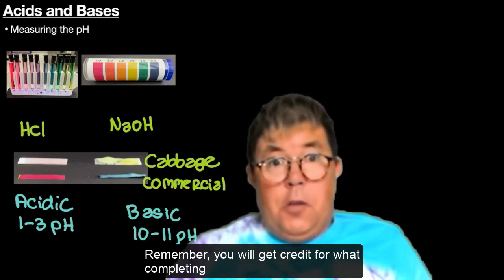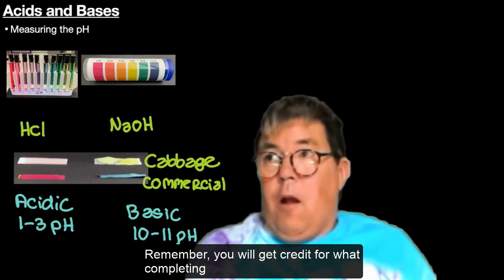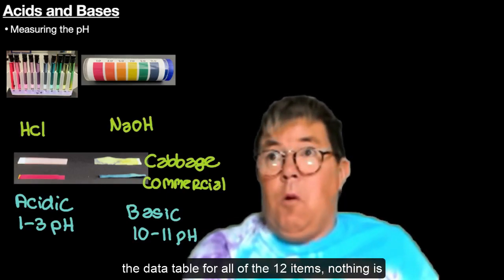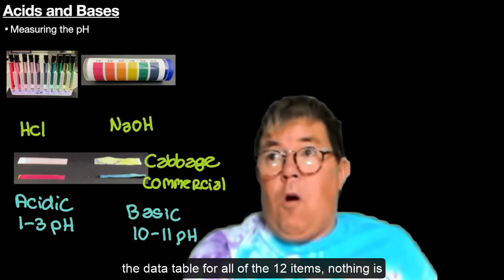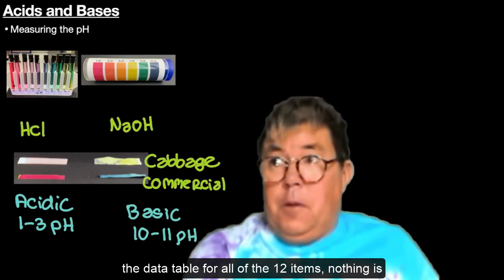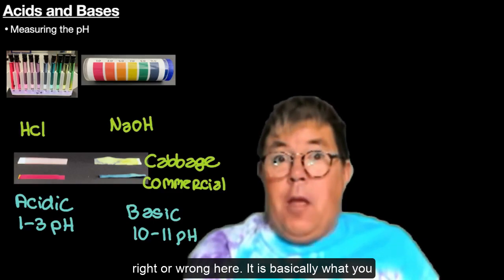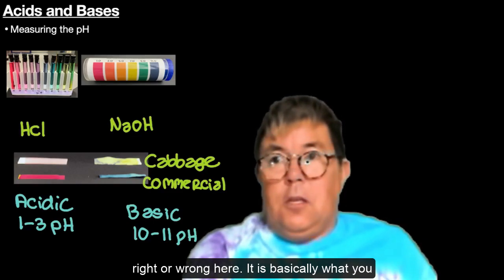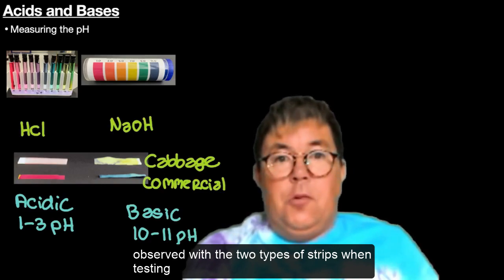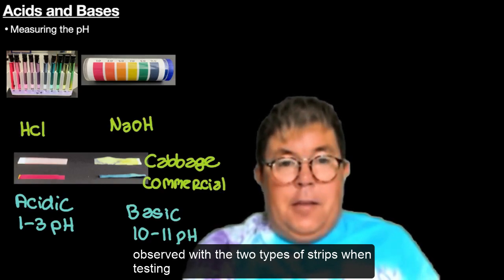Remember, you will get credit for completing the data table for all 12 items. Nothing is right or wrong here — it is basically what you observed with the two types of strips when testing the household substances.